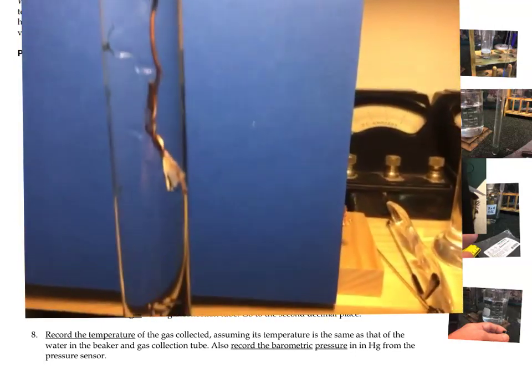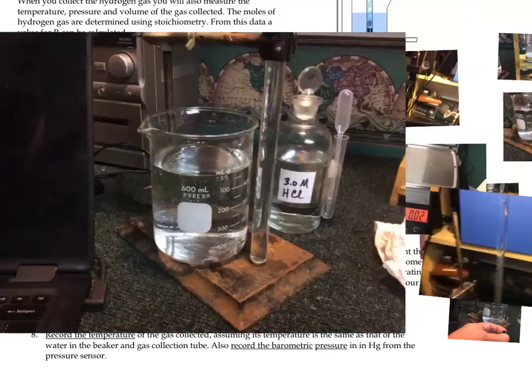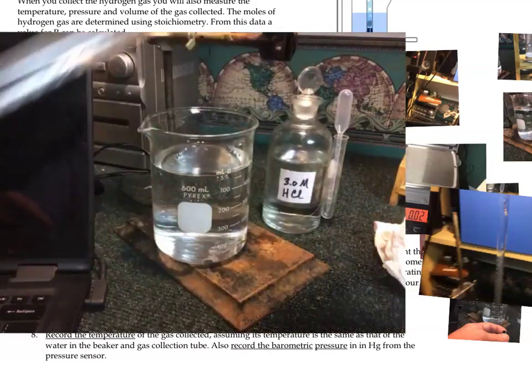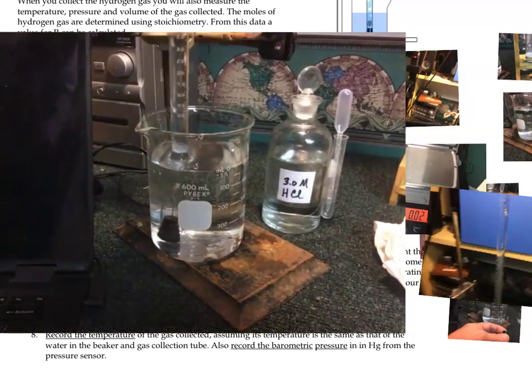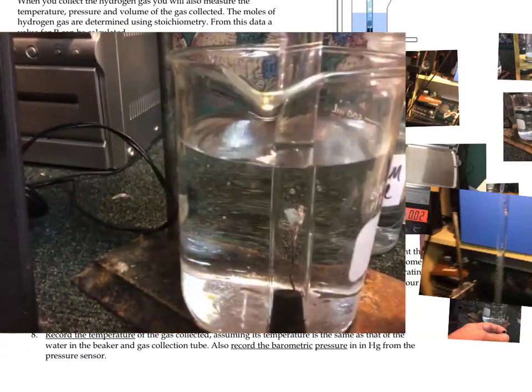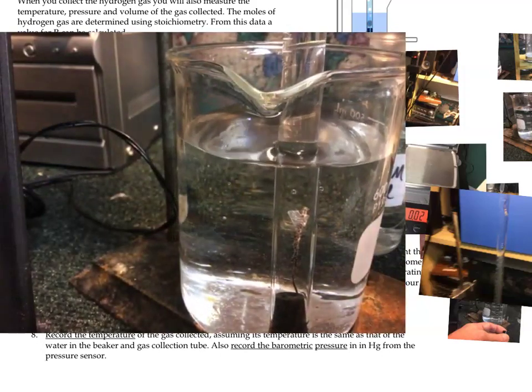Now when we tip it over, we have to get our eudiometer upside down into this large container. So I'm holding this on this end, submerge that in there, and then the acid will start to flow down. You can see the acid coming down. Eventually it's going to hit the magnesium and start to react with it. Let me get it in the clamp here.